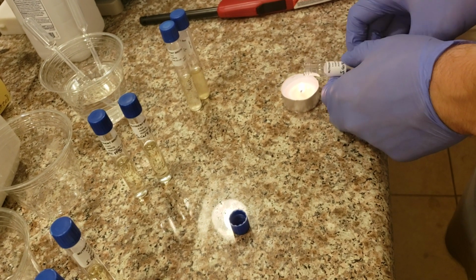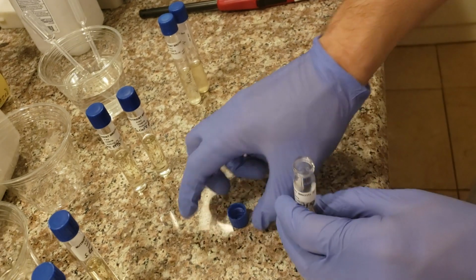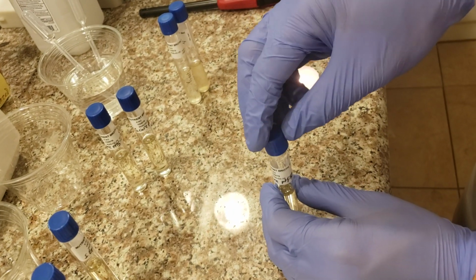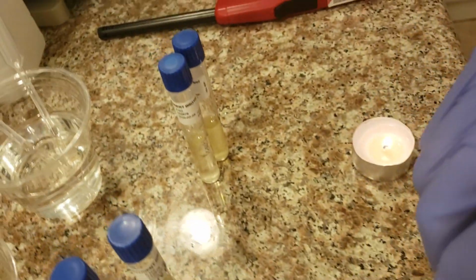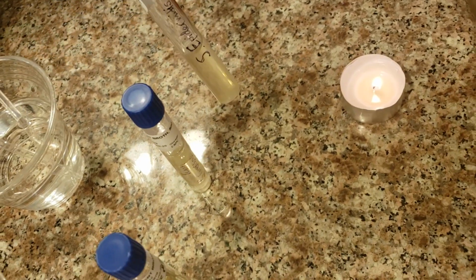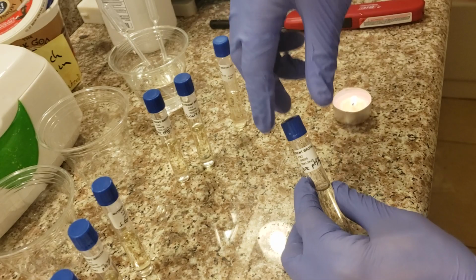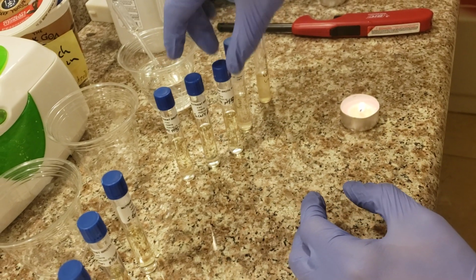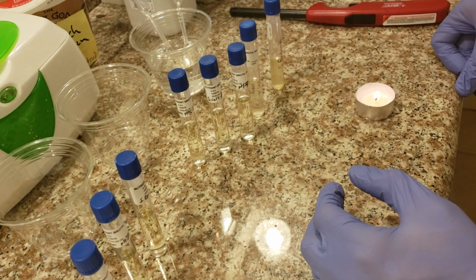And sterilize the lid. All right, because of time constraints, we're going to cut things short here, but essentially what's going to happen after this point is I'm going to add 2 drops of active cultures, just like in exercise one, and that's the S. cerevisiae and the S. epidermidis. Then we'll let it sit there and see if it develops any sort of turbidity. Thank you.